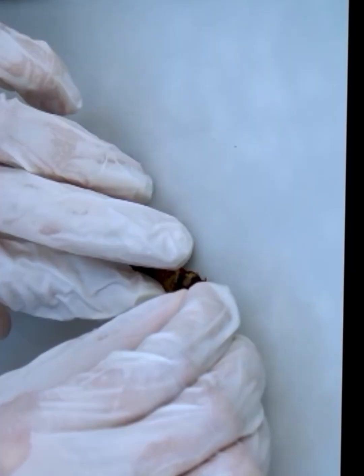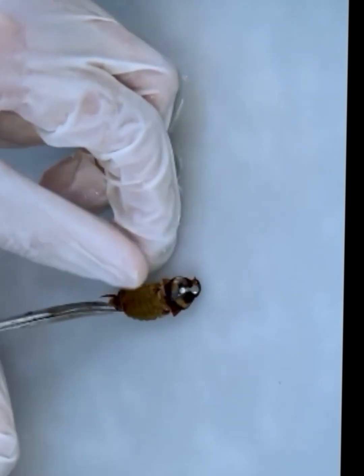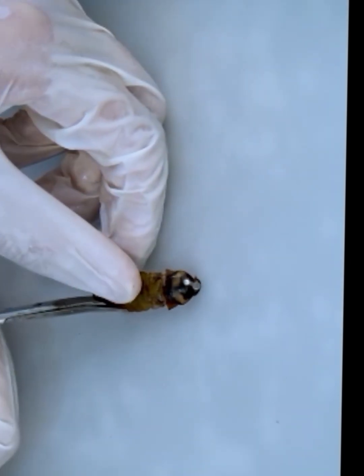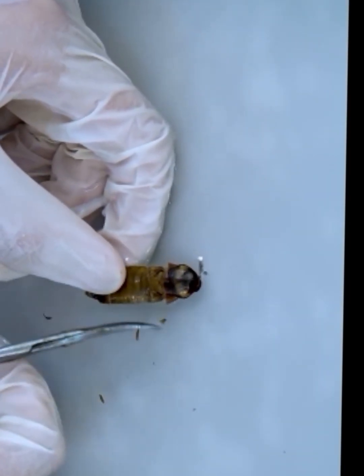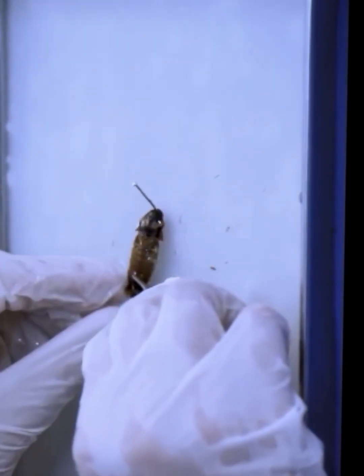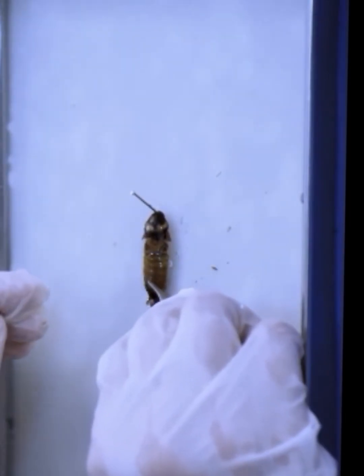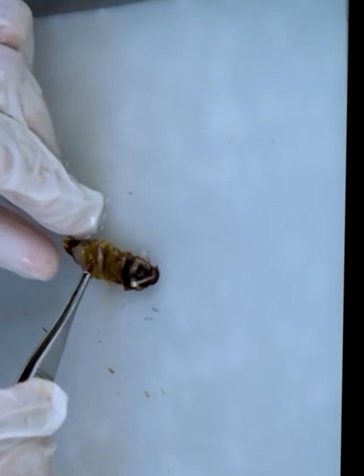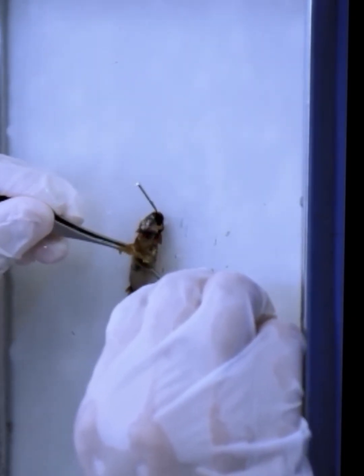by using dissecting scissors, we will make an incision along the lateral sides of the thorax and abdomen. The same procedure we will repeat on the opposite side. Also, these cuts should be very shallow and controlled, because cutting too deeply can damage the internal organs, because we know very well that the cockroach is very delicate, and the purpose of this incision is to separate the dorsal body wall while keeping the internal organs intact. After completing these cuts, we will lift the dorsal exoskeleton using the forceps, and we will carefully remove the upper exoskeleton so that we can expose the internal anatomy.